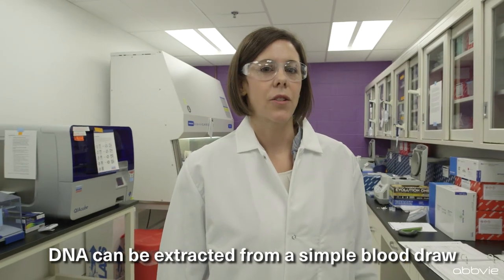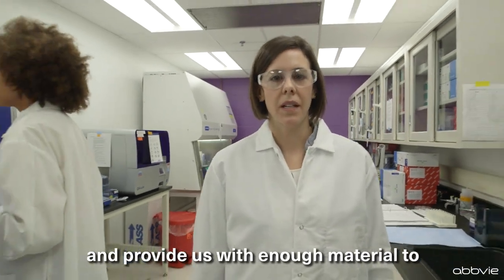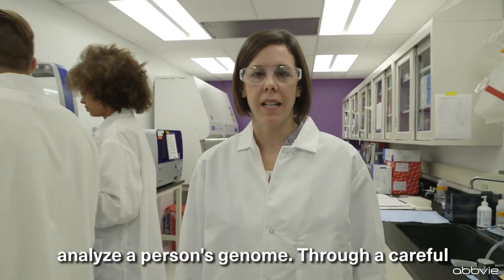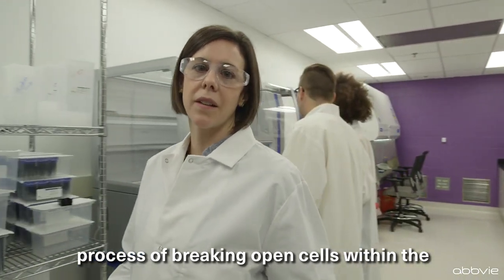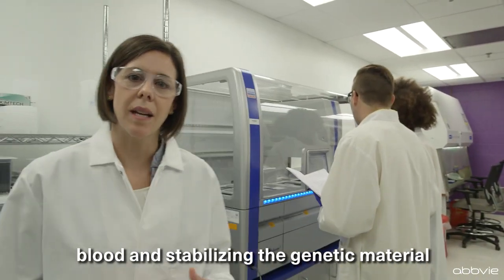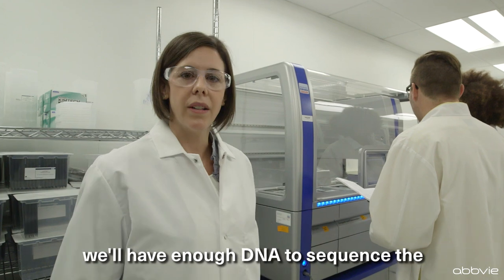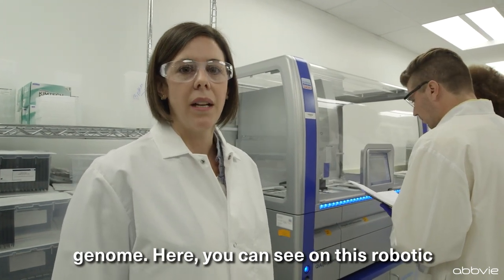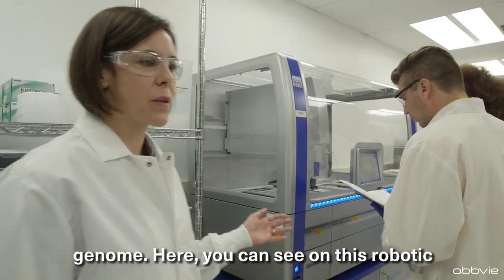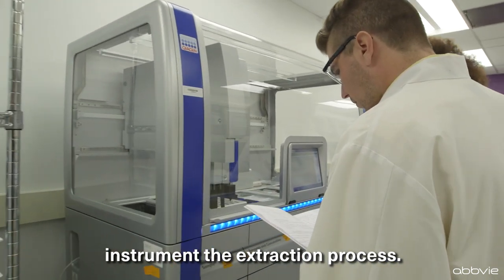DNA can be extracted from a simple blood draw and provide us with enough material to analyze a person's genome. Through a careful process of breaking open cells within the blood and stabilizing the genetic material, we'll have enough DNA to sequence the genome. Here you can see on this robotic instrument the extraction process.